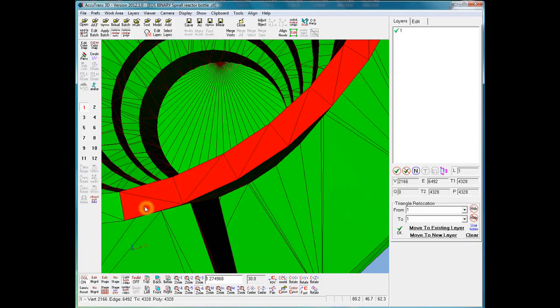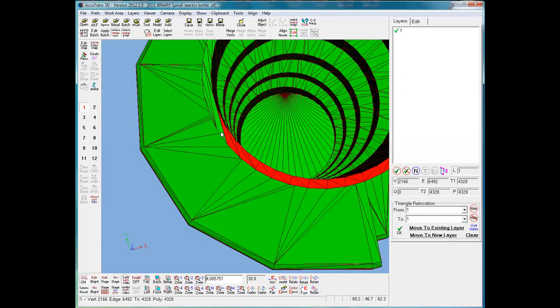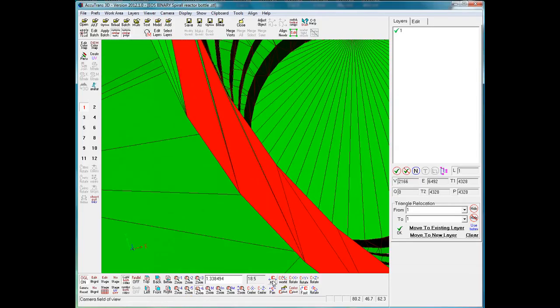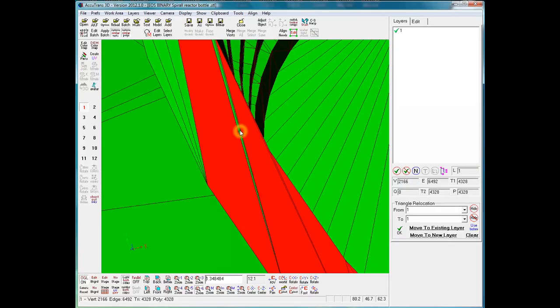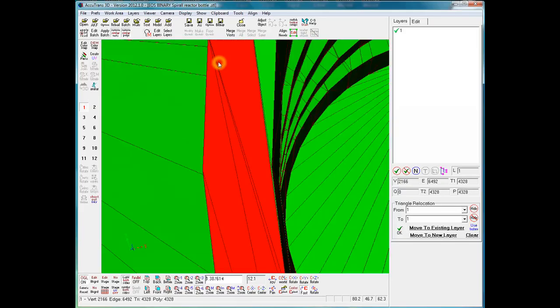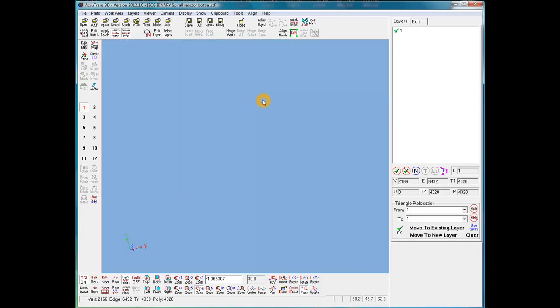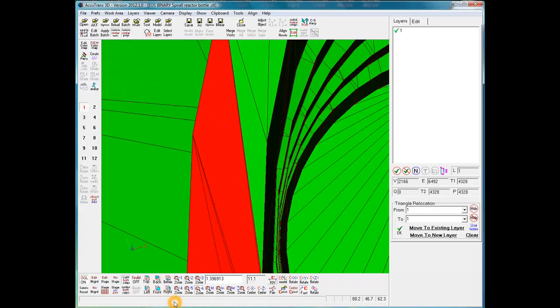And should you do the separation and miss one of them, you can always go back and move it over to the new layer that was created later on. Now, there are some more thin ones over here. We can move up a bit. There's one there, and then we have two side by side here. There we go. And we've got another one there. Set it back to the default. Okay, I do have that one.